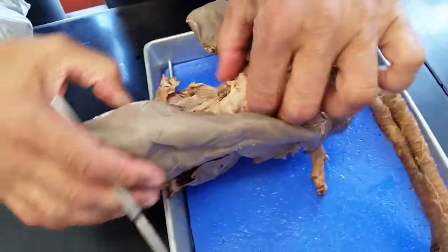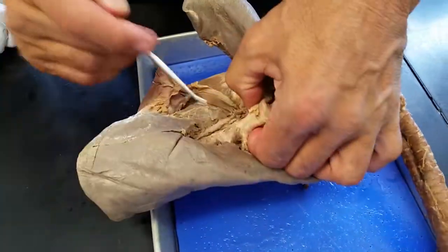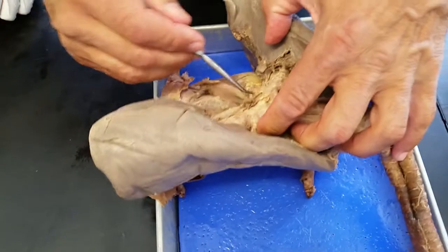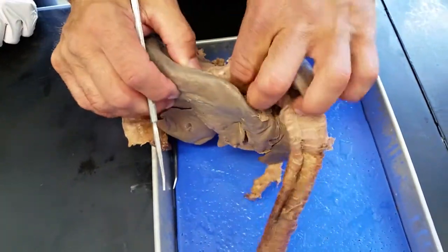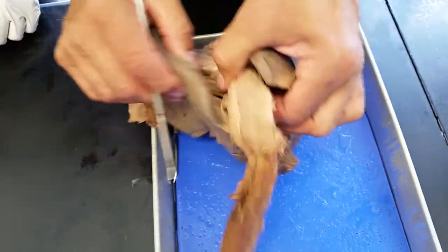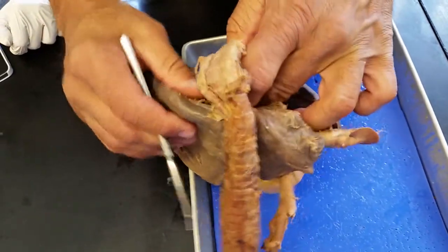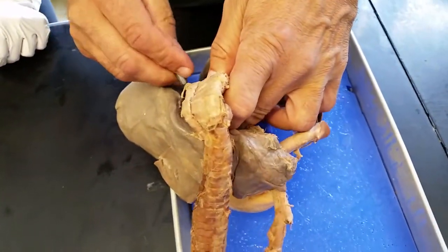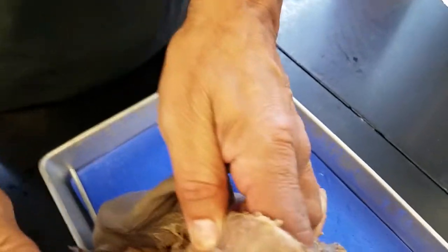And then you want to see veins — same thing. Feel for the skinny thing. You know that's got to be a vein versus an artery because they're too skinny. If we loop in here deep enough, coming around here would be the artery right up here. That would be a pulmonary artery right there, way up front here where my finger's touching.